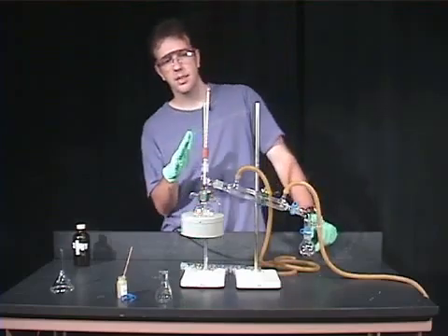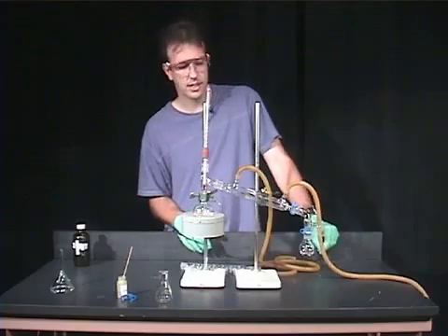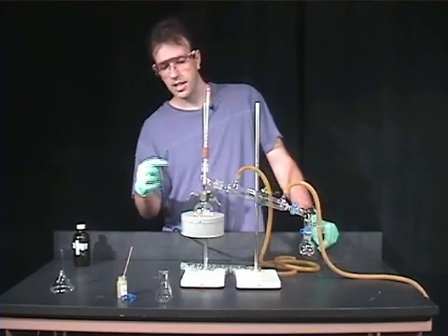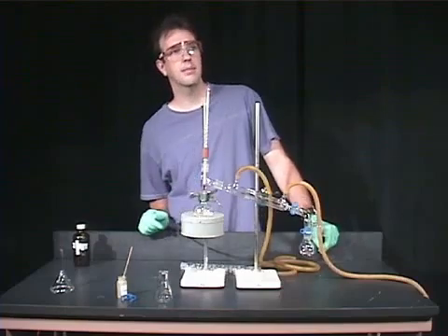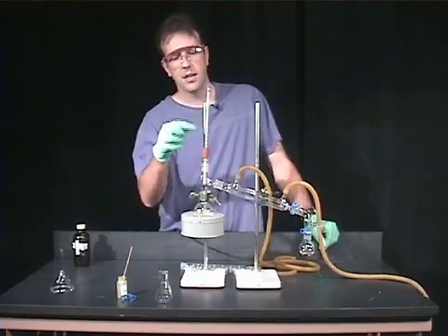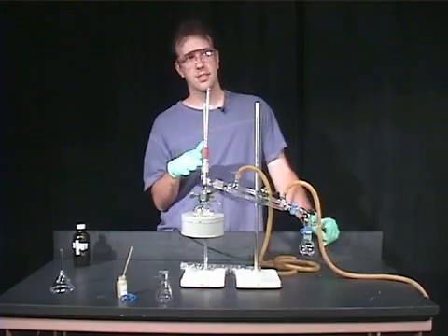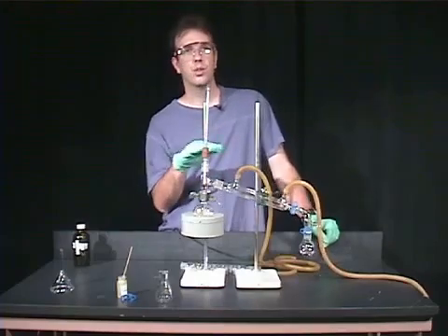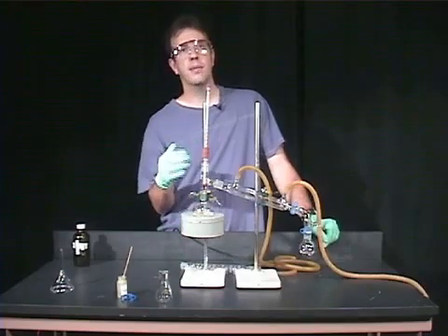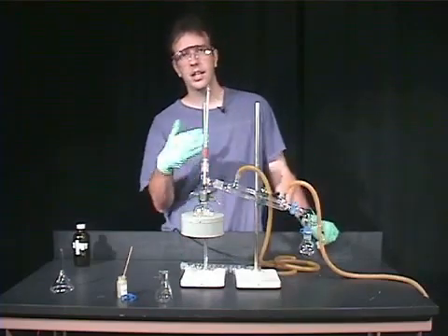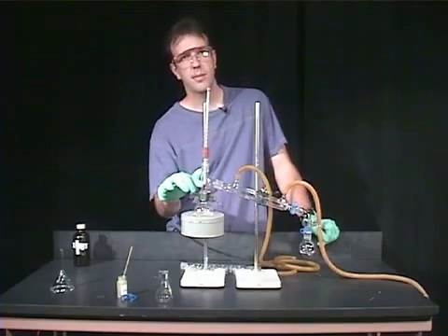Some of the issues that may arise when you're doing a simple distillation is that some people will get confused when reading the temperature of the thermometer. Initially, the thermometer will read room temperature between 20 and 25 degrees before you start to heat. And as you heat, the temperature of the thermometer will not increase tremendously. It will not increase until the vapor reaches the thermometer bulb.